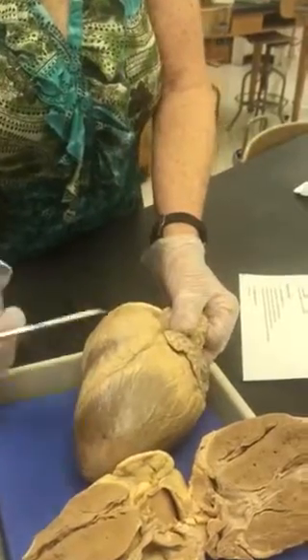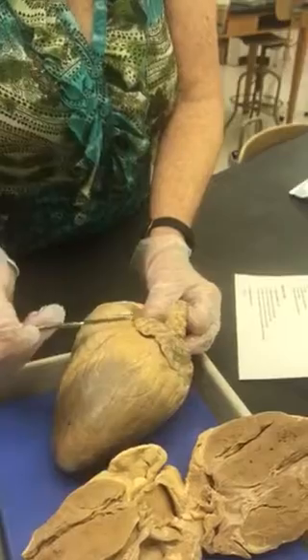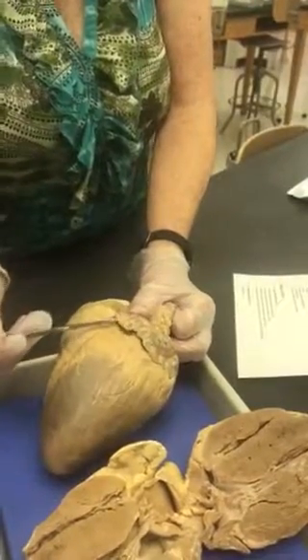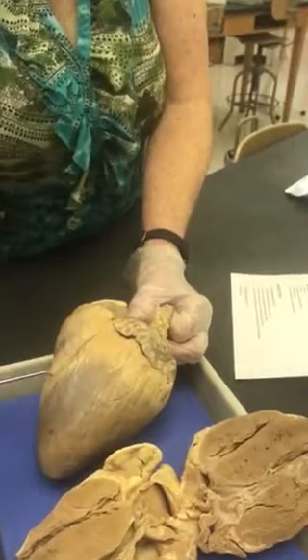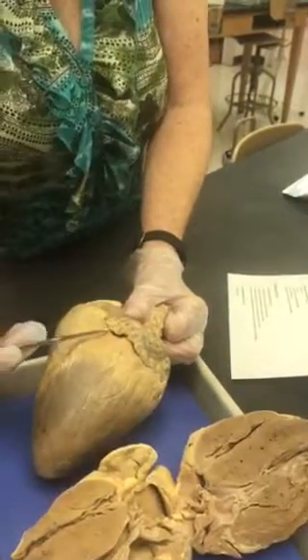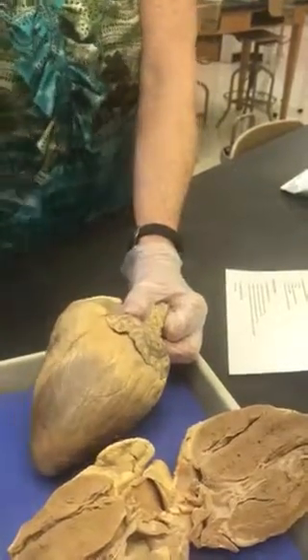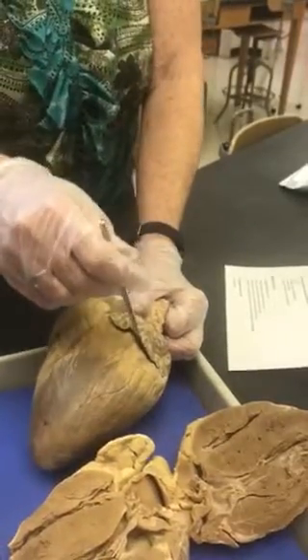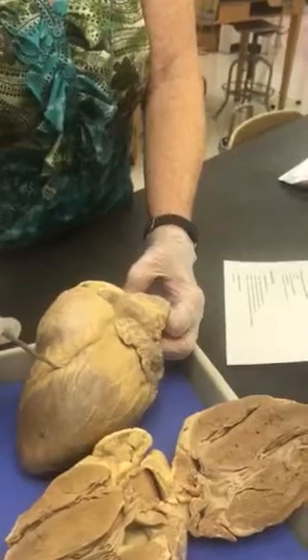All right, let's see. Mention the anterior interventricular artery. That is a branch of the left coronary artery. Now I won't ask the left coronary artery because it branches right when it gets here. So the anterior interventricular artery, and then the circumflex artery is the other branch of the left coronary. All right, so if I say name the large artery here, left coronary artery. Name the large artery here, anterior interventricular artery.